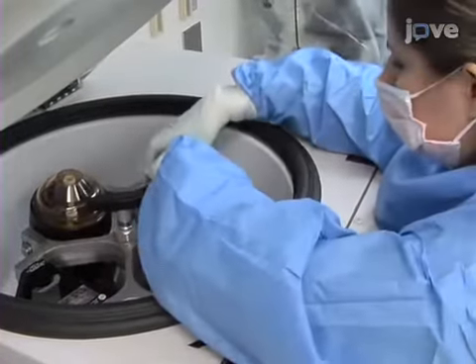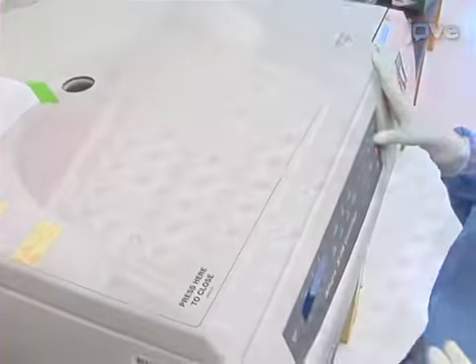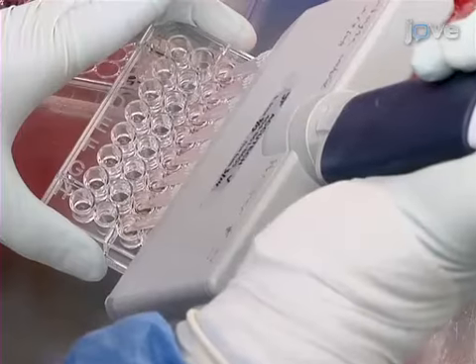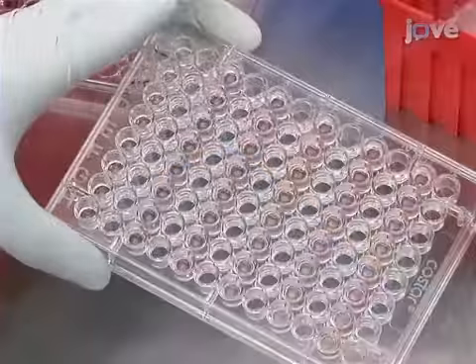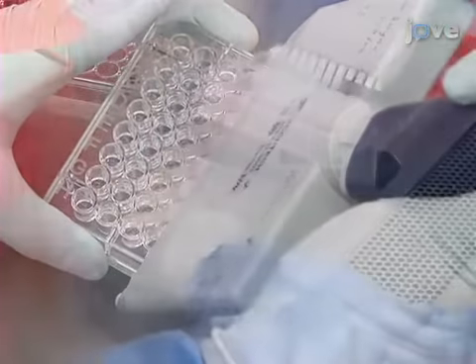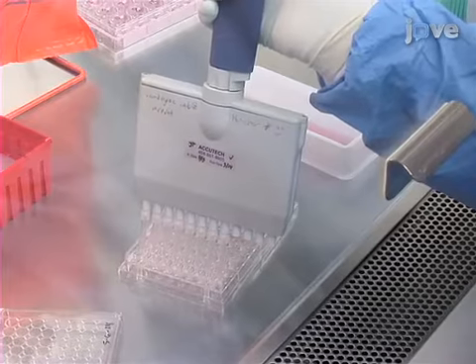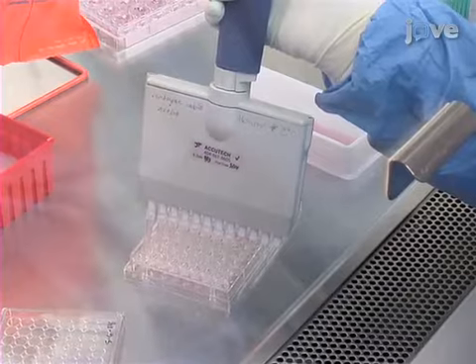In order to wash the infected cells, centrifuge the 96-well V-bottom plate to pellet the cells. Then, carefully remove 150 microliters of the medium and replace with a fresh 150 microliters of CRPMI without disturbing the cell pellet. Repeat the procedure 2 more times to sufficiently wash the cells. After the last centrifugation and the addition of 150 microliters of CRPMI, resuspend the cell pellet with a multi-channel pipette.